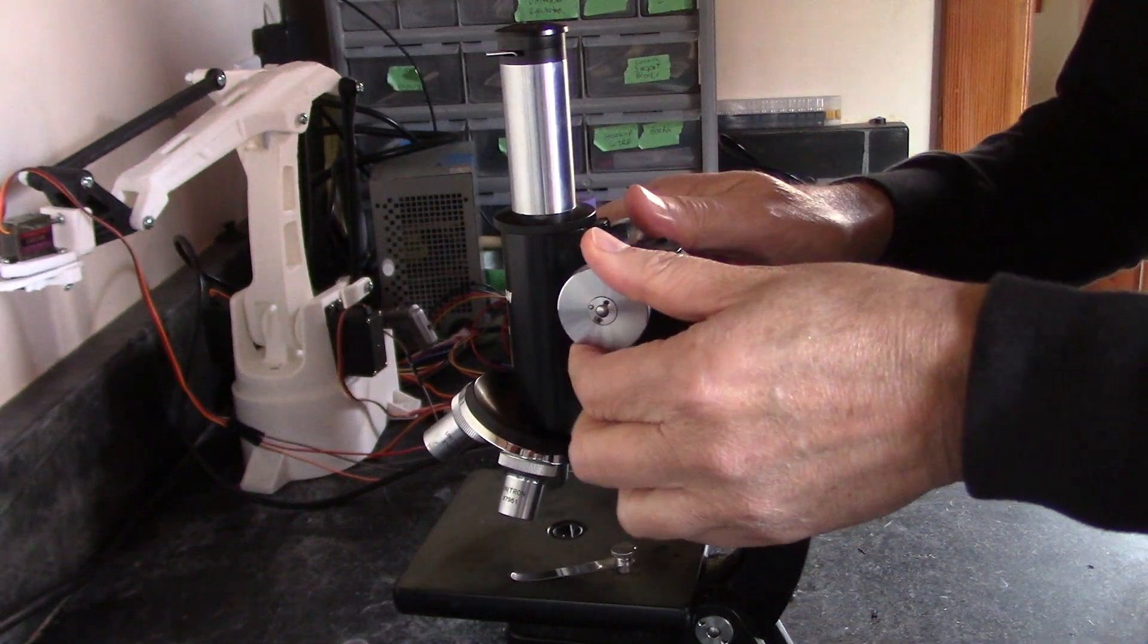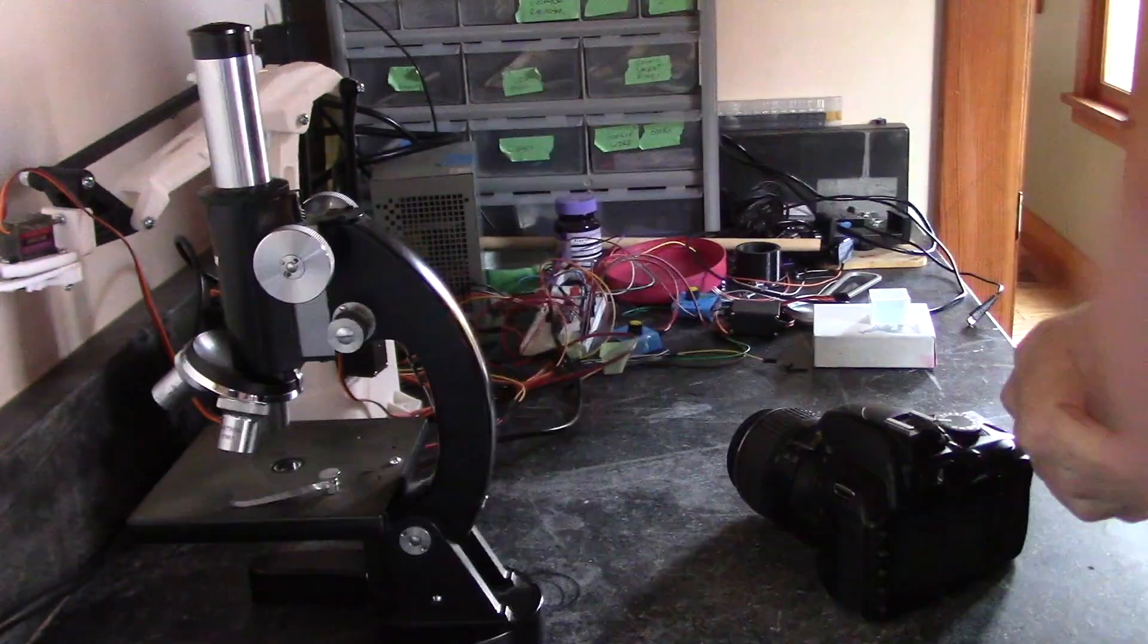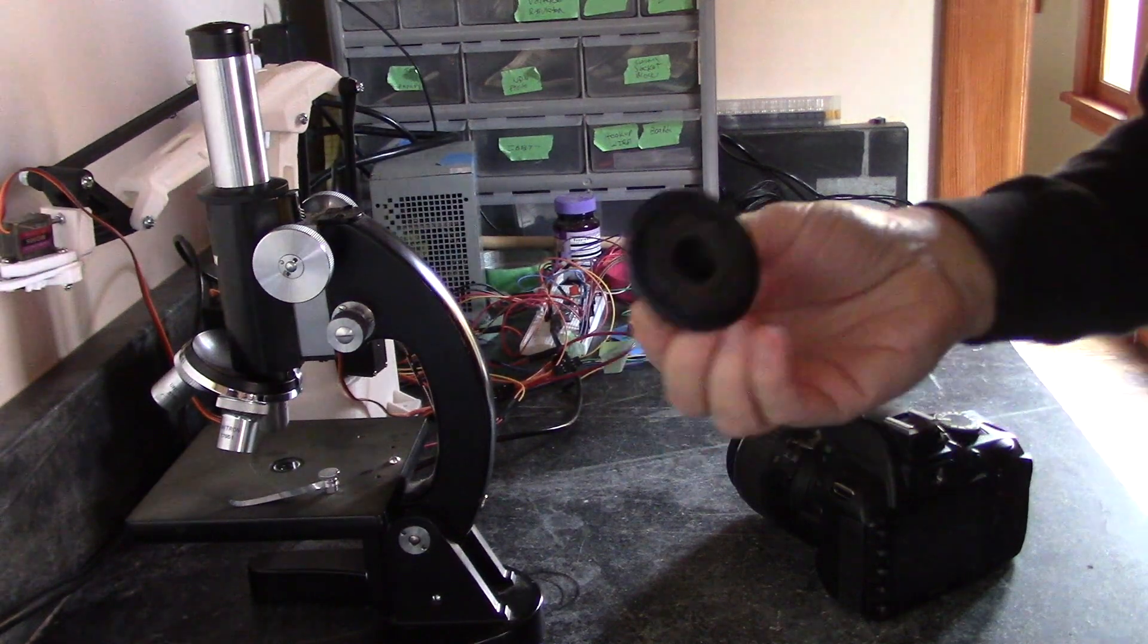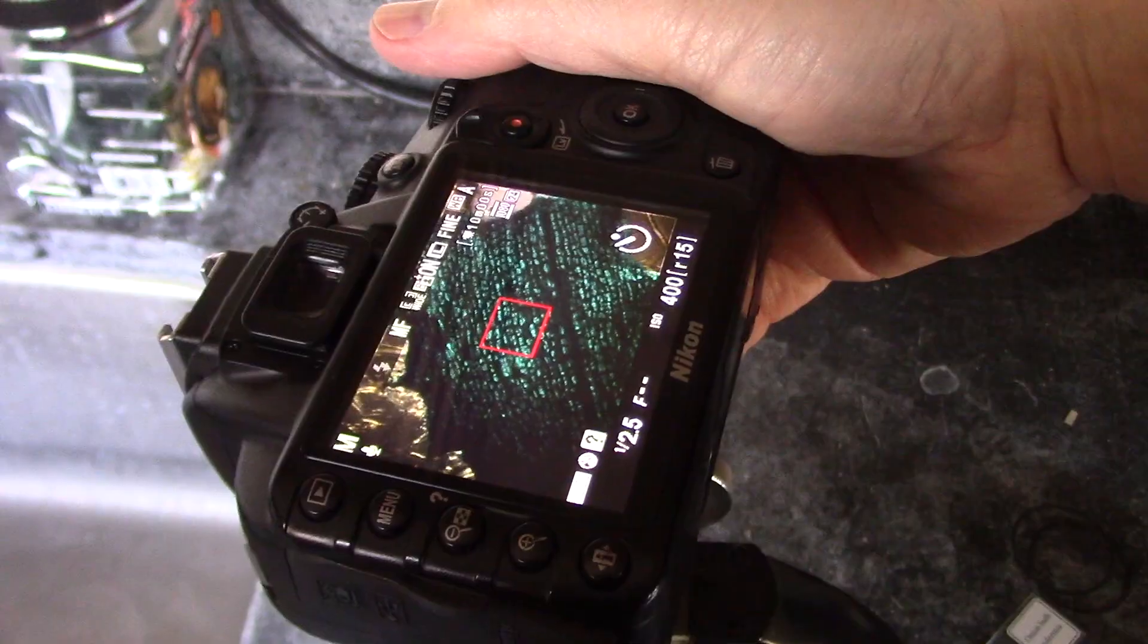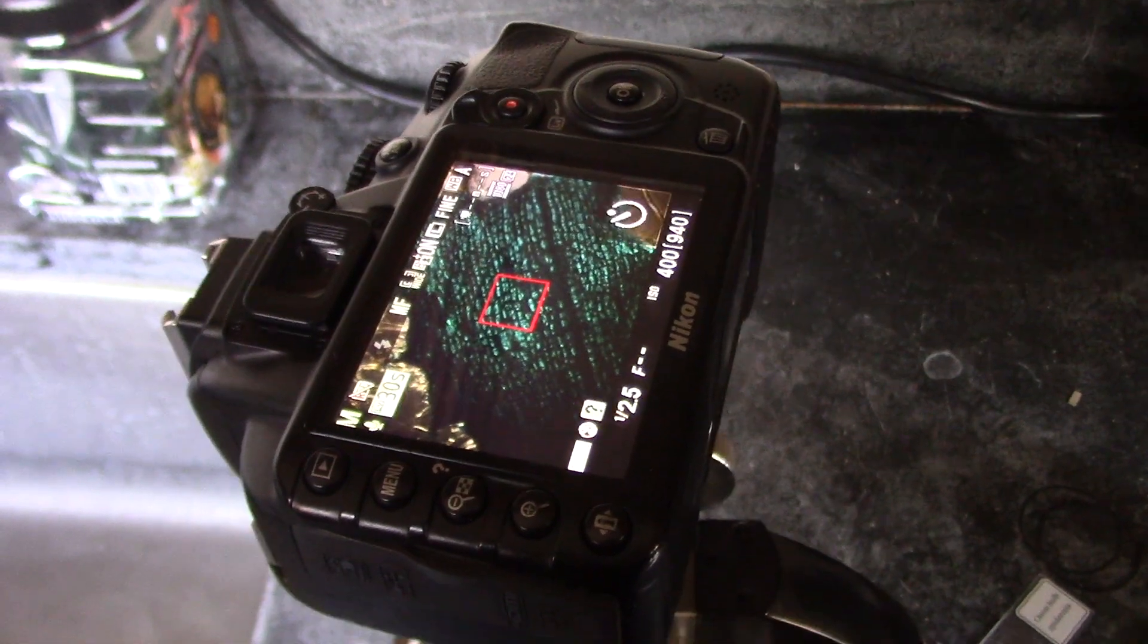In this video I want to show you this vintage high quality microscope that I picked up at a thrift store and show you how to print out an adapter so that you can take images with your DSLR camera.